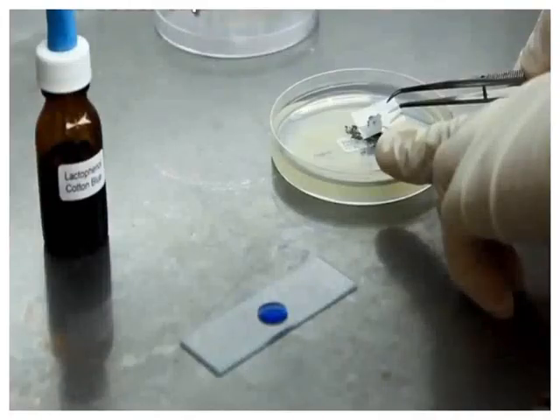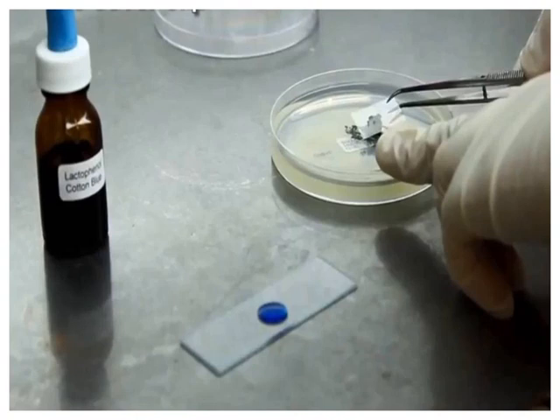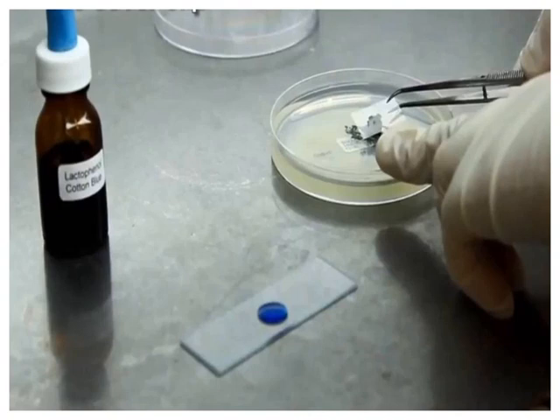After understanding the basic structure of these important groups of fungi, the next question is how we can observe these fungal organisms under the microscope. The method used is called a wet mount of fungi. The procedure is very simple: on a clean, grease-free slide, a drop of lactophenol cotton blue is placed. This stain is used to visualize the internal structures of fungal organisms. The stain contains phenol that kills the fungal organisms, lactic acid that preserves the internal structure, and cotton blue that specifically stains the internal structures.